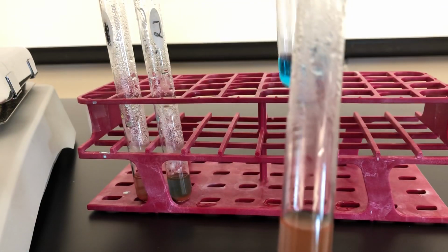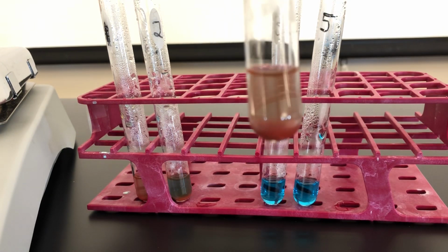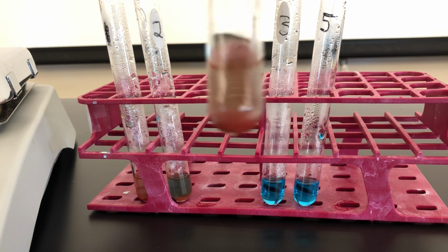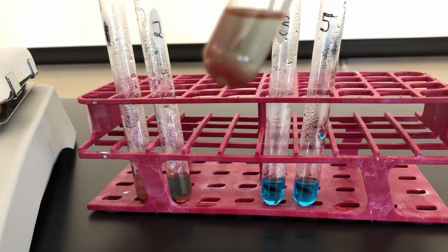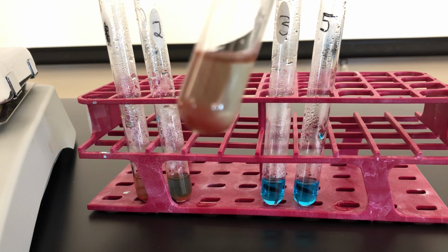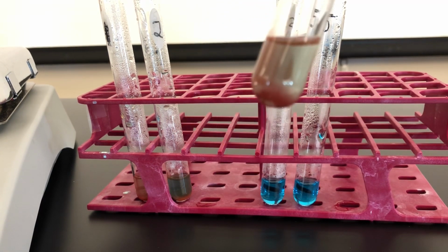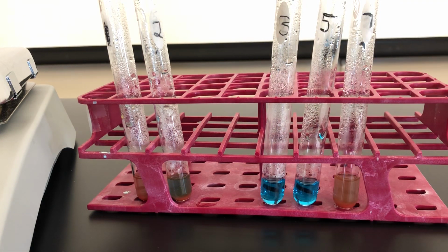But test tube 7 represents 10 minutes of being, 15 total minutes of incubating or being hydrolyzed with hydrochloric acid, and we do have a positive result. So this indicates that hydrochloric acid was able to hydrolyze at least some of the starch, though not all of it. Record your colors and answer the interpretation of results questions below.